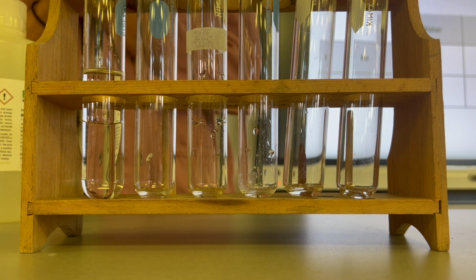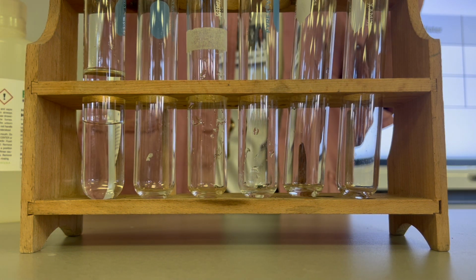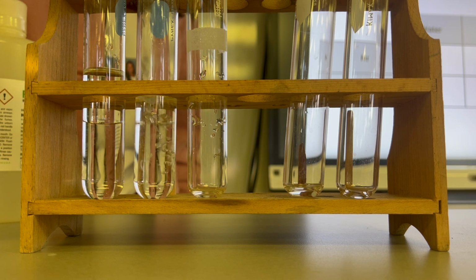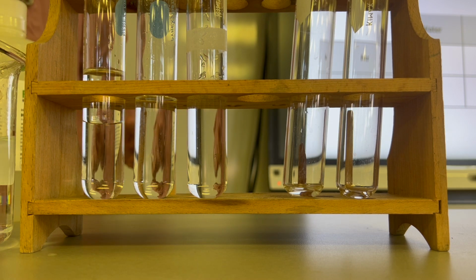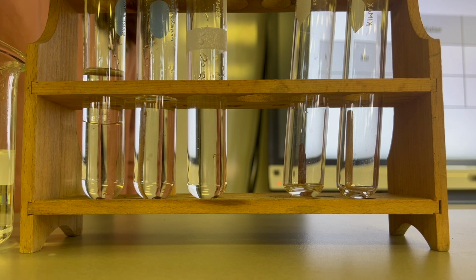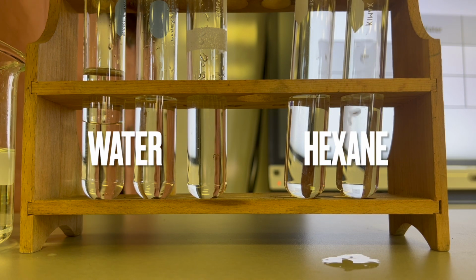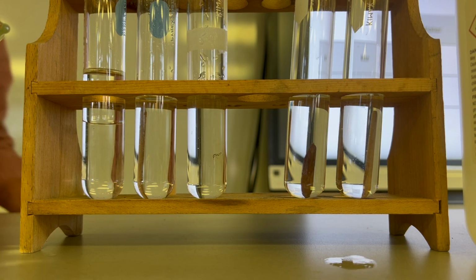All right, so the next ones now, we're going to mix them each with iodine and potassium permanganate. So I'm going to pull this one out so we don't get confused. The first 2 are going to have water in them. So there's water. The second 2 are going to have hexane in them. So this is going to be hexane in this one, and hexane in this one. All right, I tried to have about the same amount. So the first thing I want to add is the iodine.